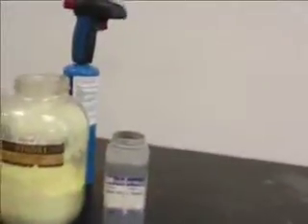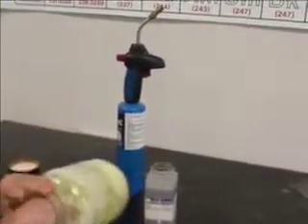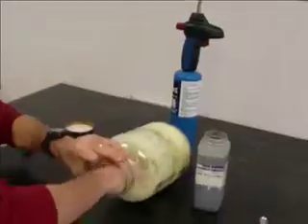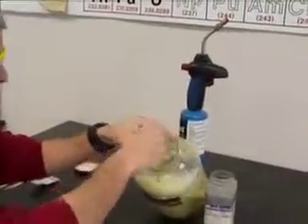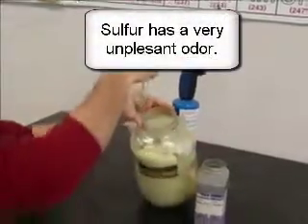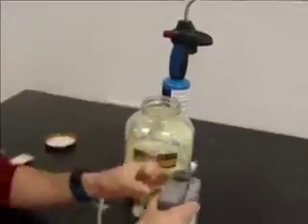Okay, so what I'm going to do is take this test tube and put some of my sulfur in. This is a big amount of sulfur, isn't it, Mr. Sanders? That is, but it smells lovely, doesn't it? All right, so I have some sulfur in there, and then to that, I'm going to add some iron metal.